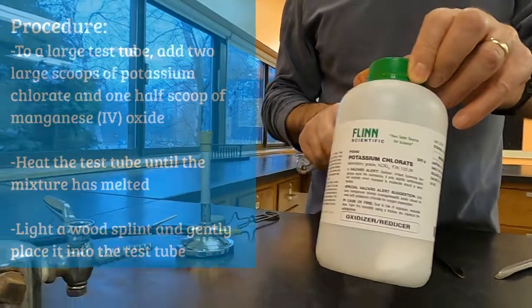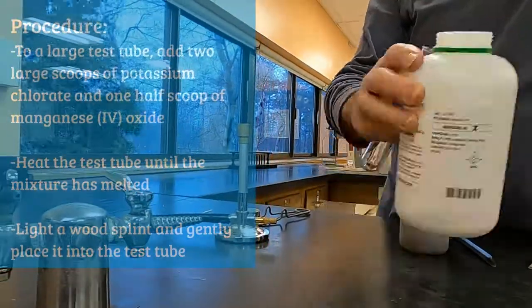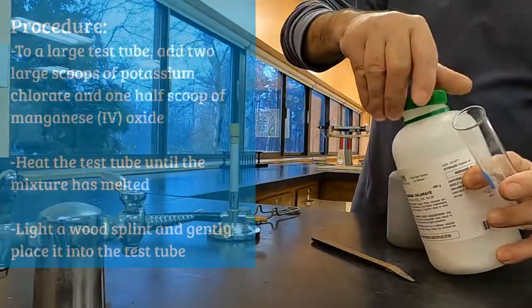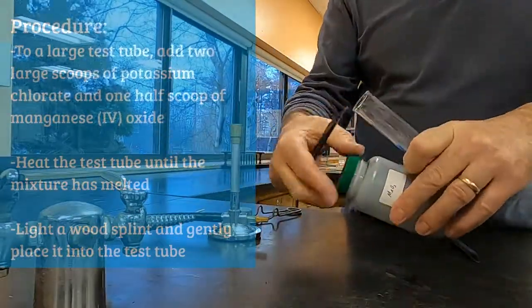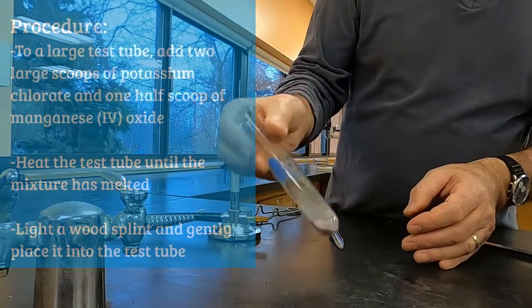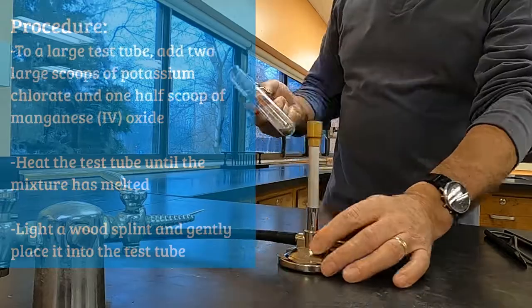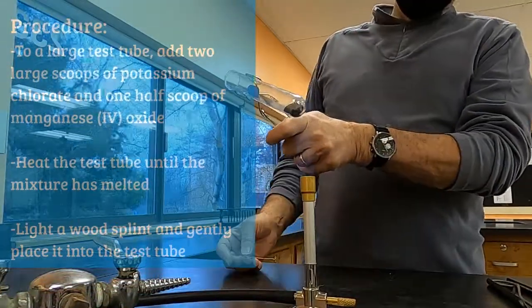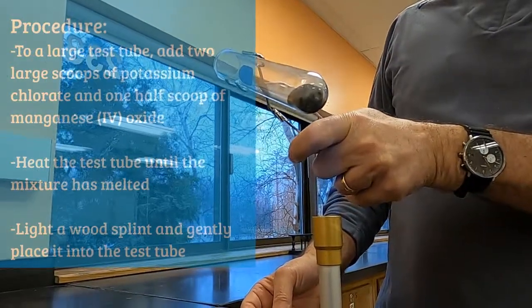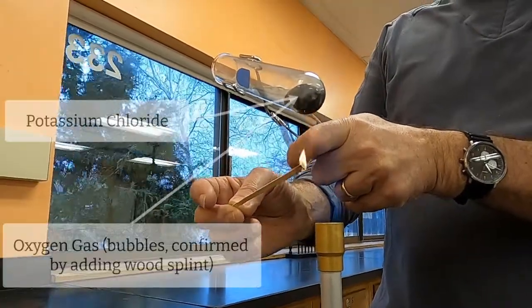This reaction is using heat and a catalyst to turn potassium chlorate into potassium chloride and oxygen gas. The manganese 4 oxide is a catalyst and so would appear over the arrow in the balanced chemical equation. And the product of oxygen gas is going to be confirmed by putting in a burning wooden splint. The wood is not a reactant or product in this, it's just to confirm that the bubbles that are being given off are oxygen gas, because things burn much better, much more quickly in oxygen gas.